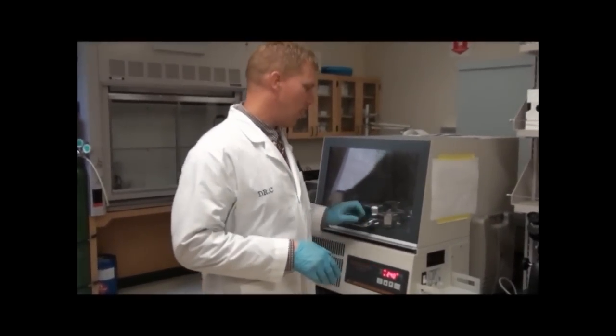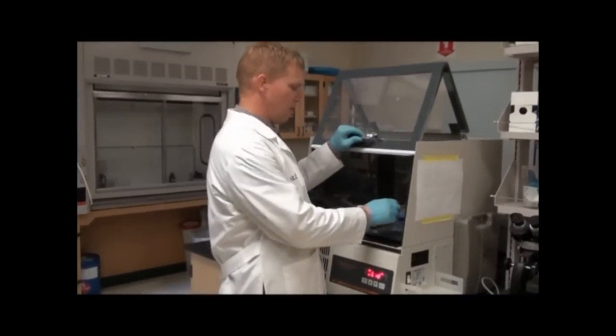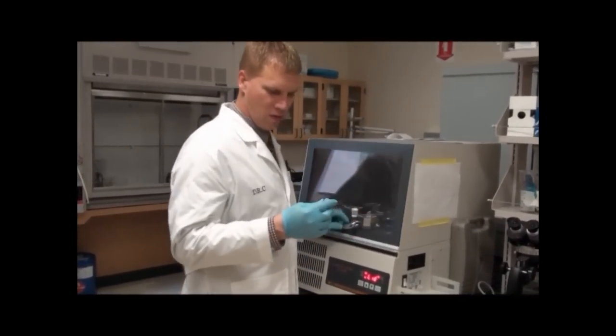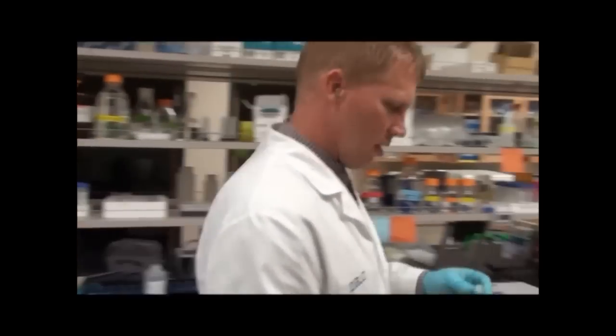It's now been about 30 minutes since we did our heat shock transformation and transferred the competent cells into a culture tube. We're now going to remove our culture and plate it on a selective media.